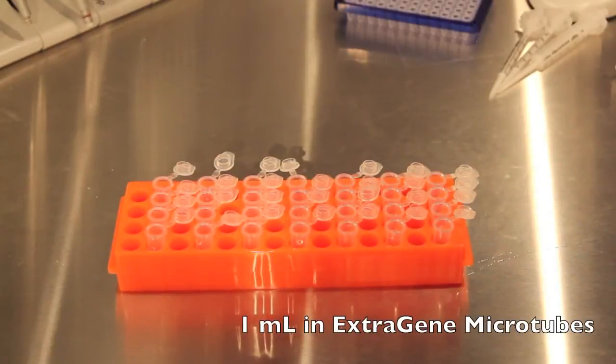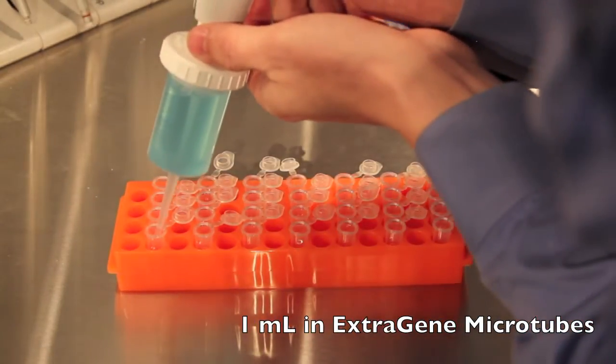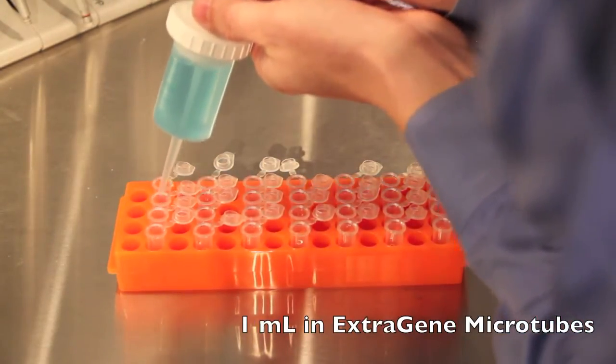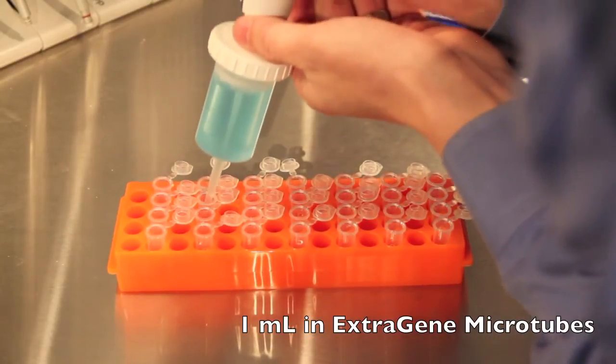Now we'll be using the 50 mil syringe to dispense 1 mil aliquots into our extragene microcentrifuge tubes.